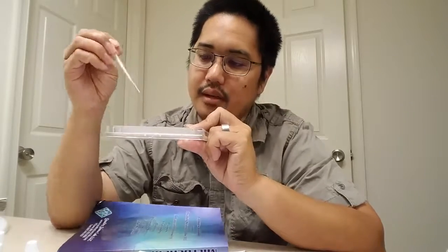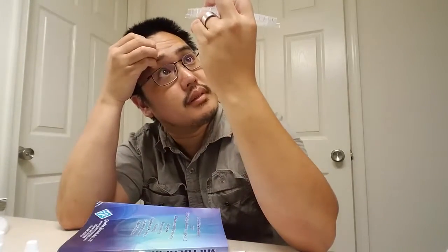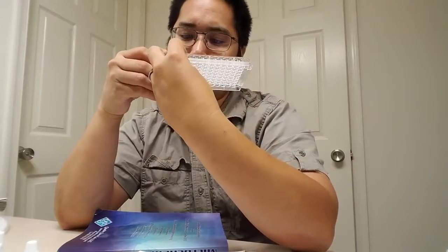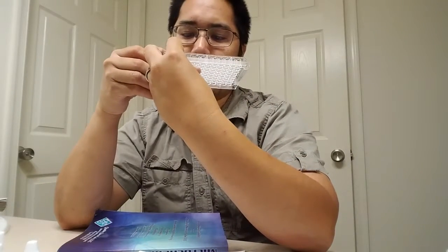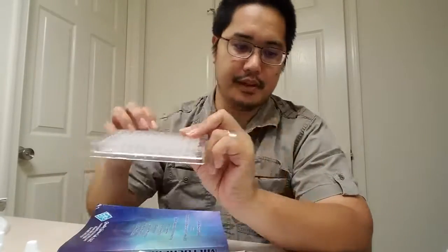And then I'm going to take 2 drops out of well number 7 and just throw it away. 1, 2. I'm going to put the rest back in well number 7. So there. That should have been consistent all the way across the board. And if you look at it, which you can't see, but I can see it, they're all pretty nicely at the same height.